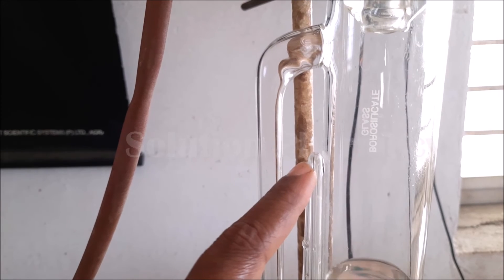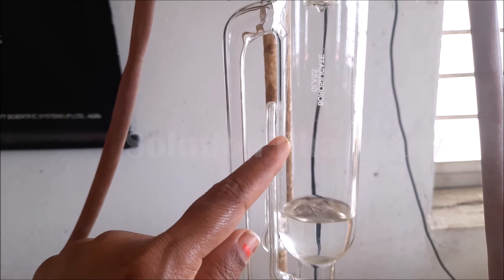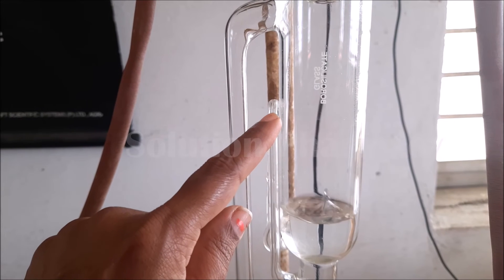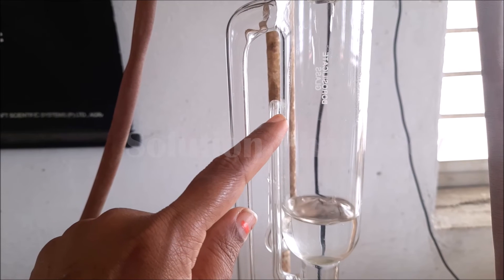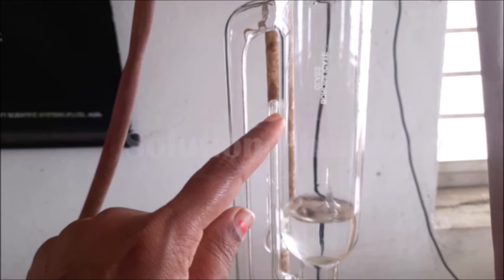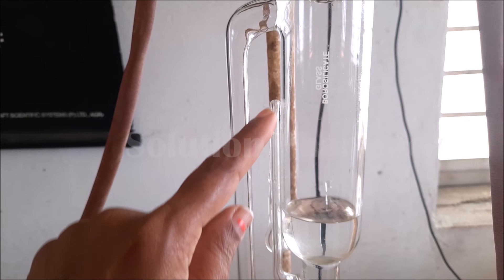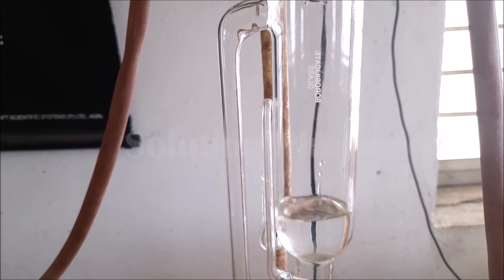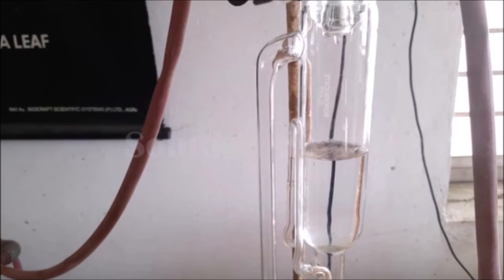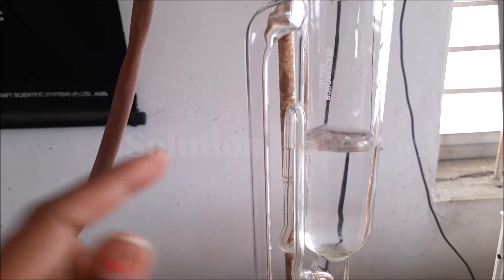Eventually the extract in the round-bottom flask becomes concentrated. The level of solvent inside the extractor increases, and simultaneously the level in the siphon tube also increases. When the level of the recovered solvent inside the siphon tube reaches just below the tip of the siphon tube, we have to stop the process. If it reaches the tip, all the recovered solvent in the Soxhlet extractor will revert back into the round-bottom flask. So we must carefully observe the level of the solvent inside the siphon tube.